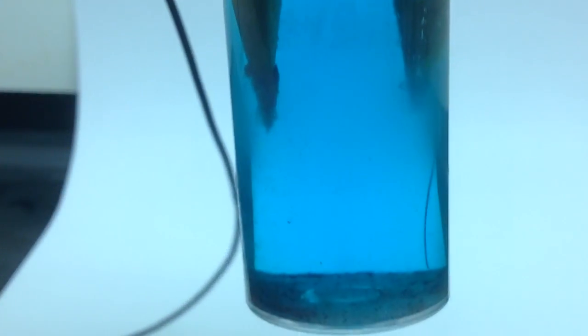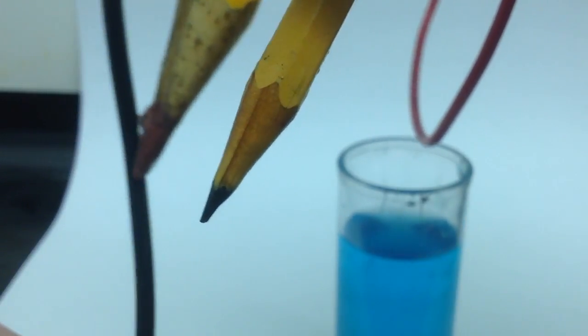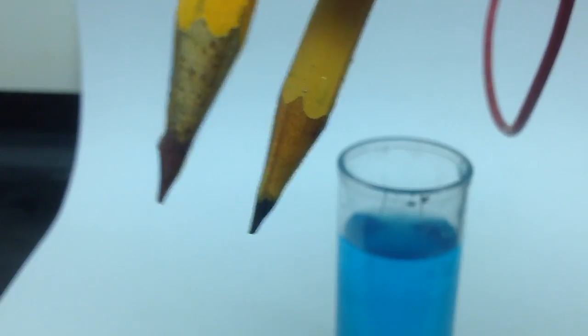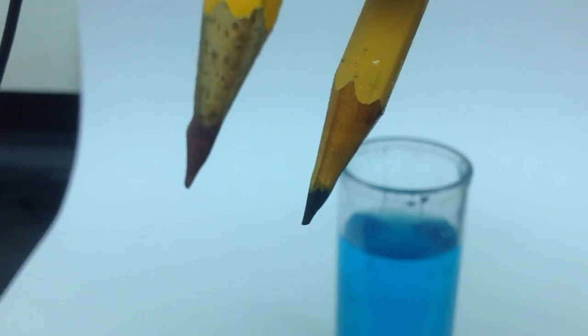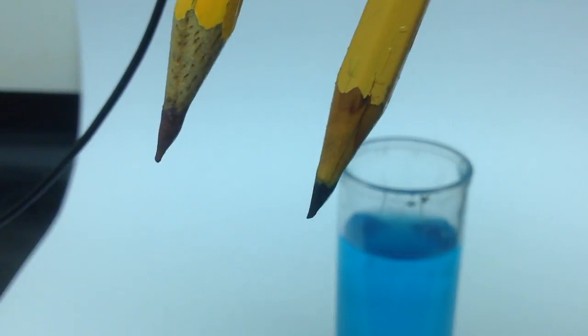Also, we'll notice that if I take this out, so we can see some color comparisons. And I might have just lost a lot of it as it fell down. But, for some color comparisons, the tip of our left electrode kind of looks a little bit more reddish-brown. And almost colored. Copper colored.